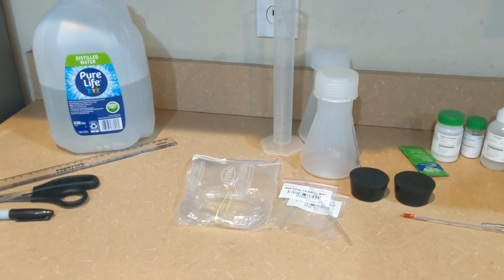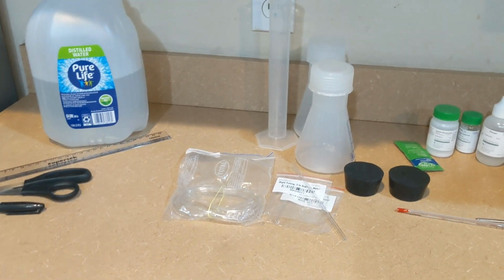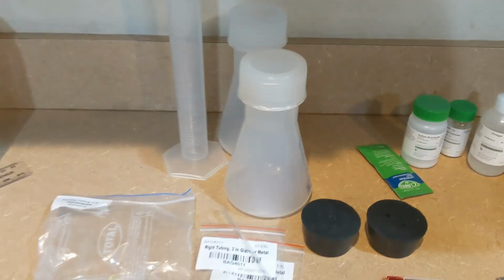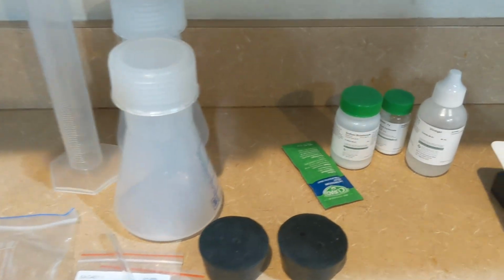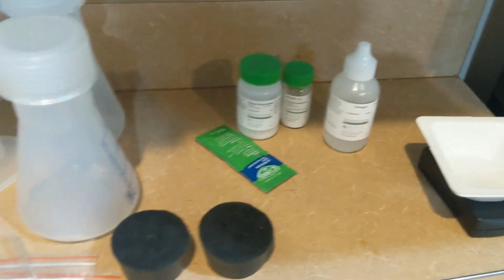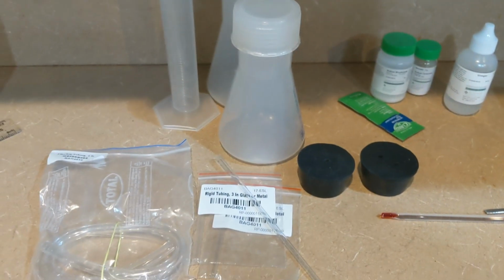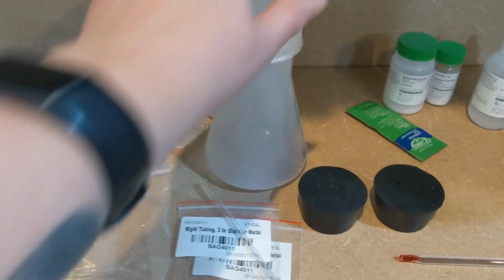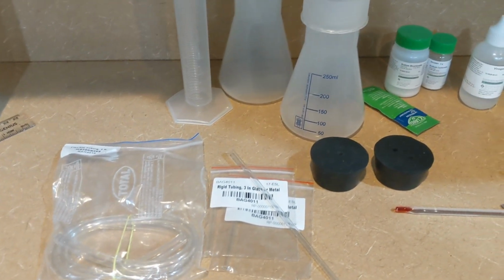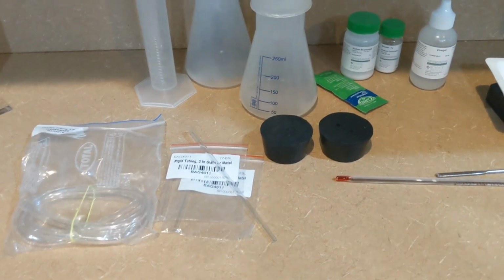So in this experiment, we're going to be looking at the moles of carbon dioxide produced by the known reaction between sodium bicarbonate and sodium carbonate with acetic acid. What we'll be doing is causing the reaction to take place, and then that reaction will create a displacement of water, and we will use the displacement of water to calculate how much carbon dioxide gas was produced.